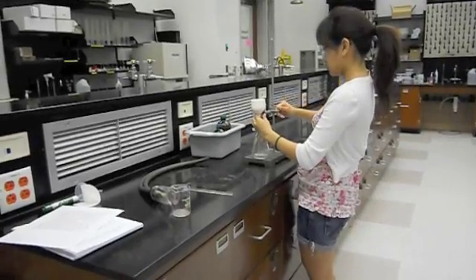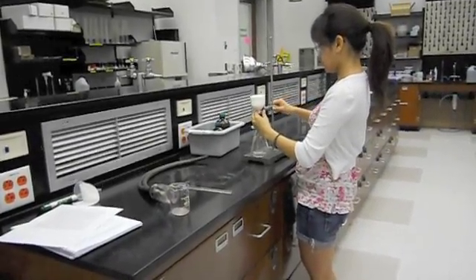Again, using a ring stand and clamp, place a Buchner funnel and a flask with a sidearm in place.